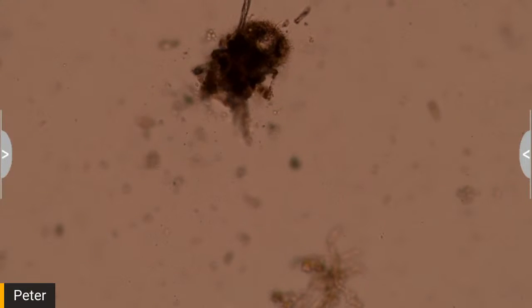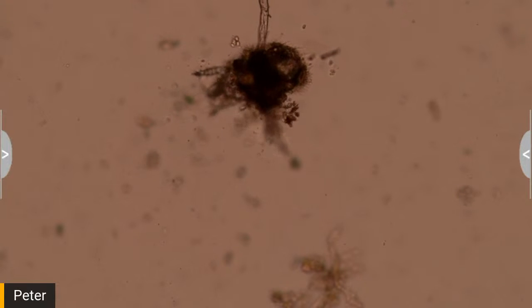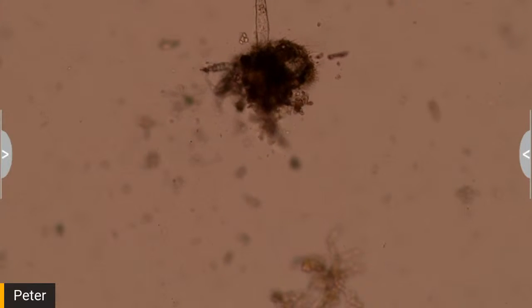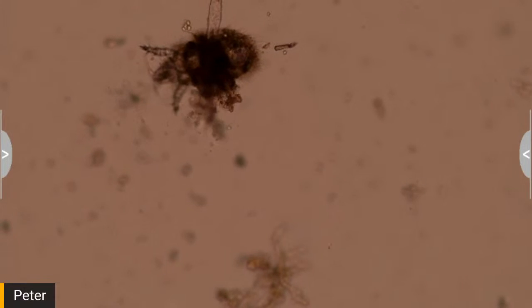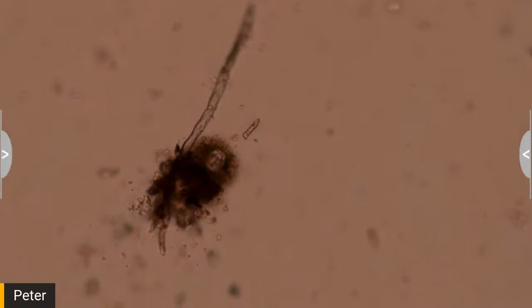Alright, just my morning microscope check, setting up the tardigrade.